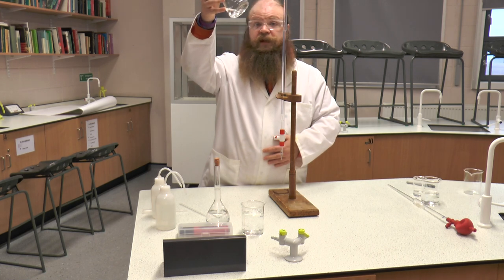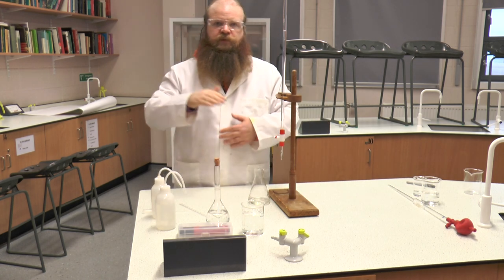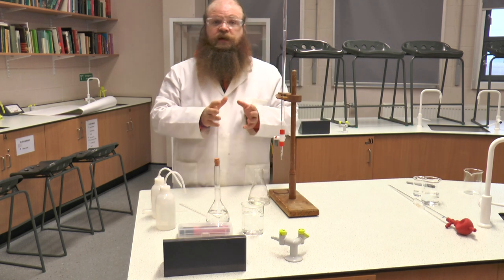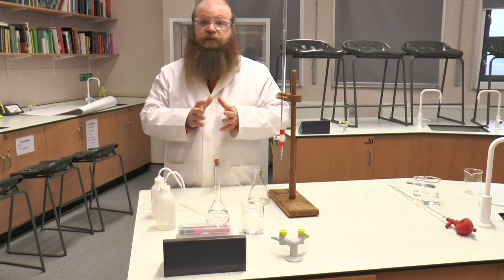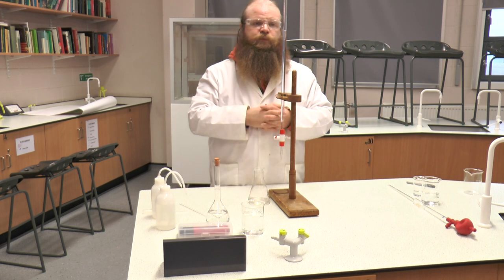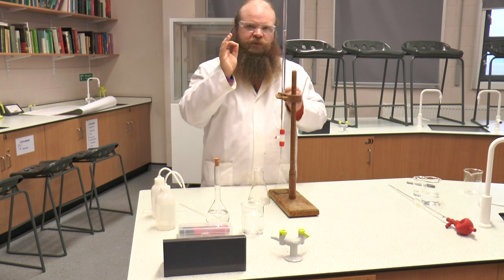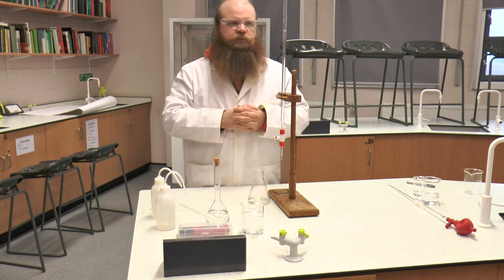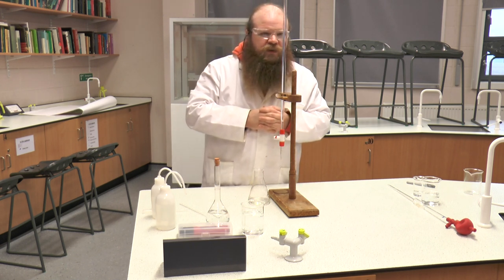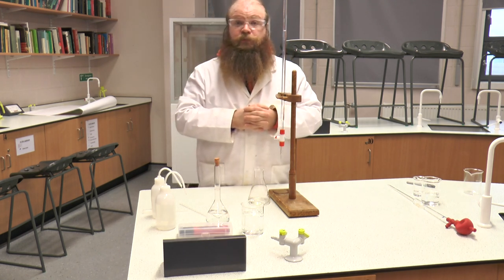As we have seen, it has gone completely colourless. But this time, rather than just doing a quick rough, we have a much more accurate reading. The last titer was an overall of 19.7. We went fast to around about 18, just shy of 19, and then drop by drop from then on. Therefore, we are able to say that that drop is the point at which the colour changed. We started at 0.1, we have a finish of 19.4, which gives us an accurate titer of 19.3.